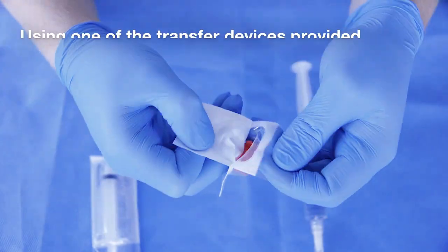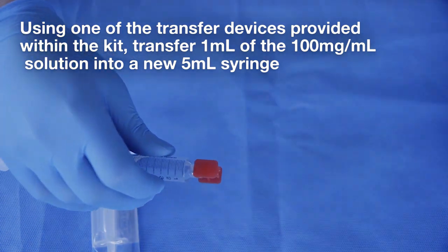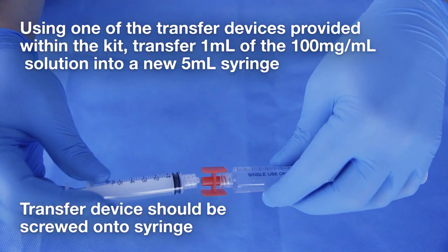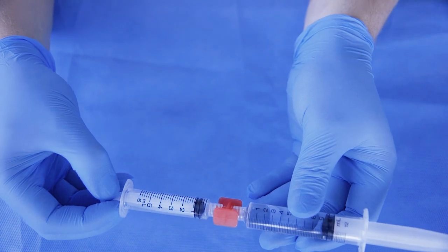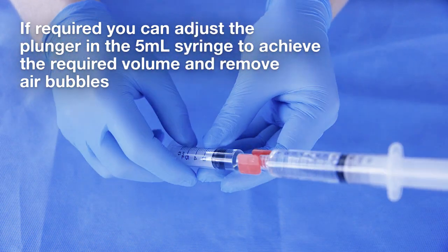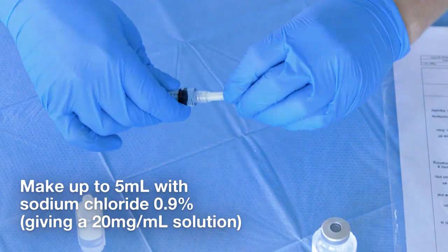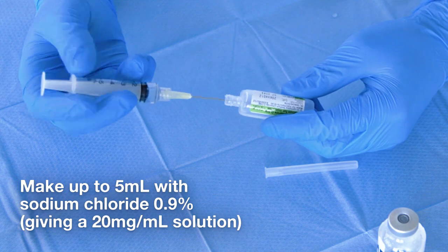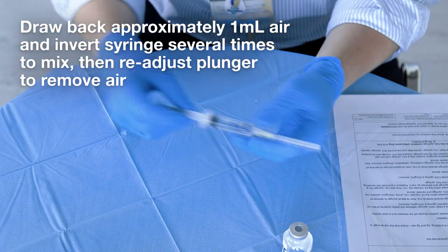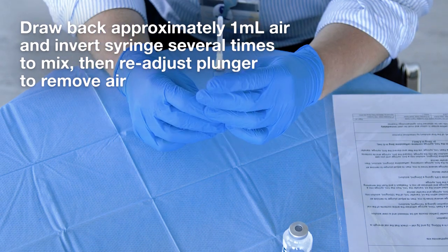Using one of the transfer devices provided within the kit, transfer 1 ml of the 100 mg per ml solution into a new 5 ml syringe. Transfer device should be screwed onto syringe. If required, you can adjust the plunger in the 5 ml syringe to achieve the required volume and remove air bubbles. Make up to 5 ml with sodium chloride 0.9%, giving a 20 mg per ml solution. Draw back approximately 1 ml of air and invert syringe several times to mix, then readjust plunger to remove air.